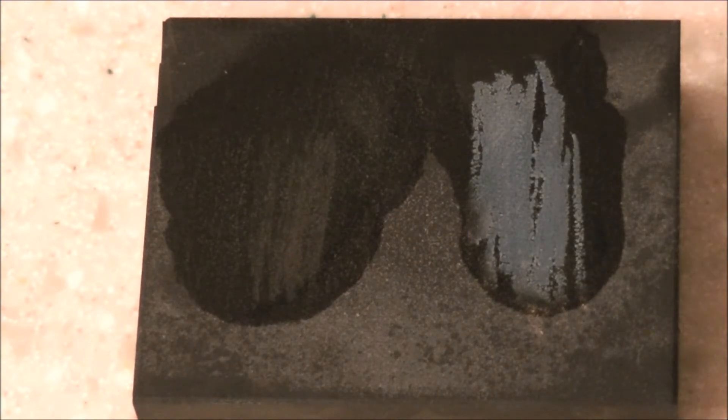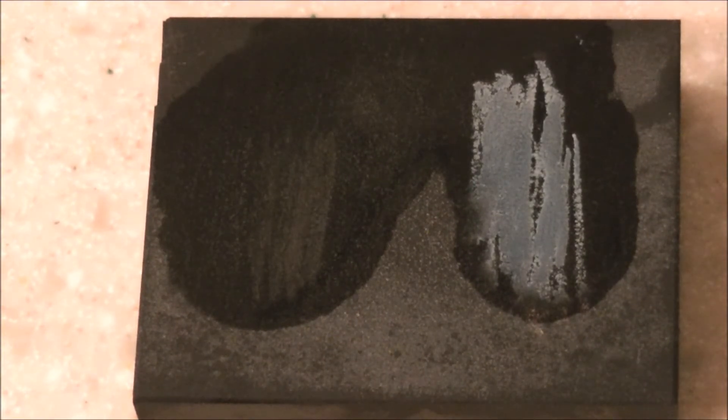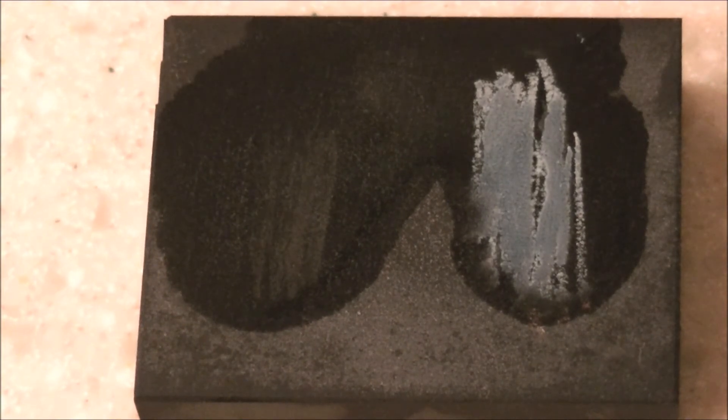It just becomes almost invisible under the acid, where the silver leaves a large, very milky colored silver behind. That is essentially powdered, unpolished sterling — not sterling because it's burned away the impurities. It's basically just silver at that point. It's very pure. So basically it just proves that the item on the right was in fact silver.